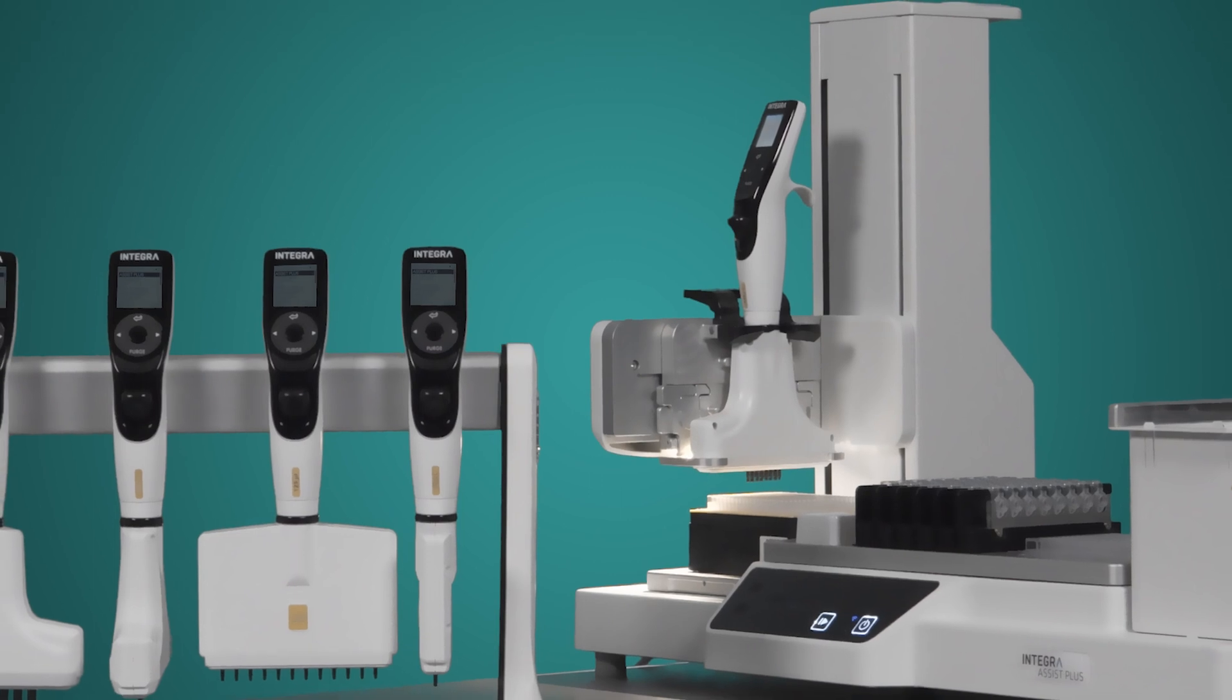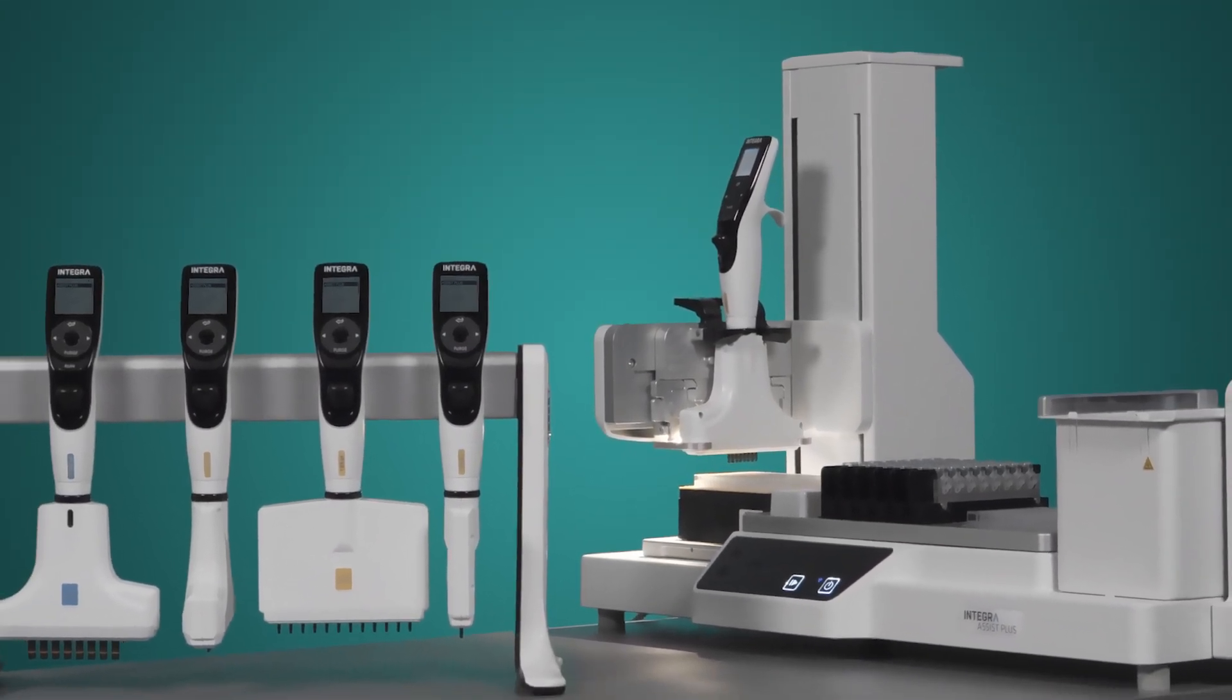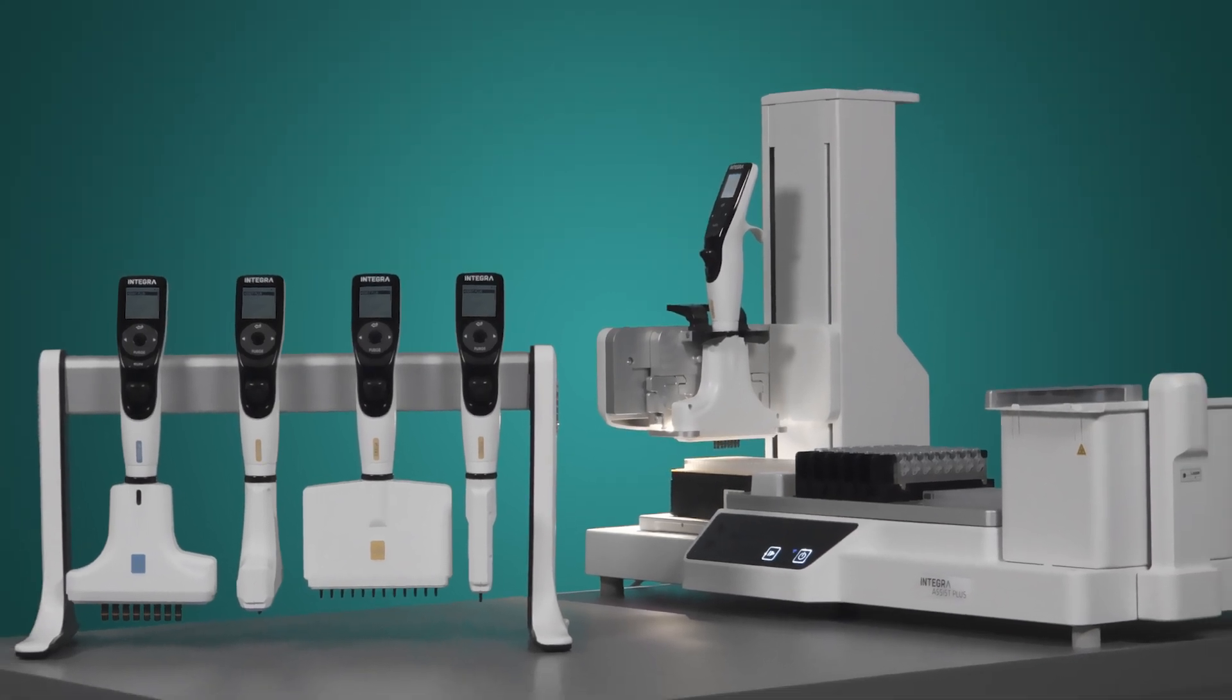Integra's electronic multi-channel pipettes and D1 pipetting modules can be easily automated by clicking them into the pipetting arm of the Assist Plus.